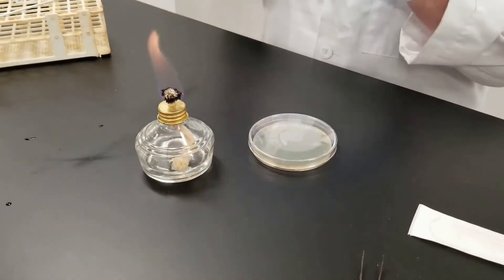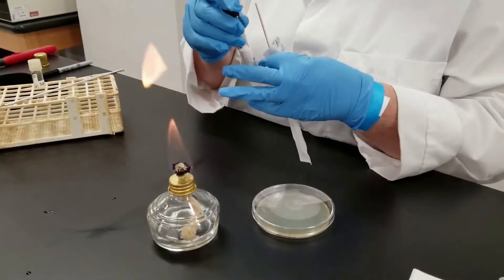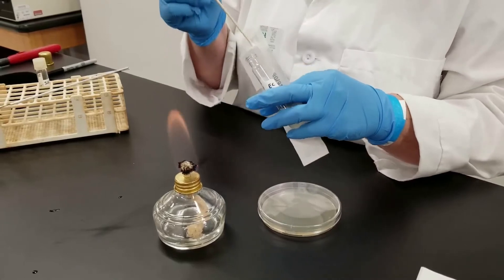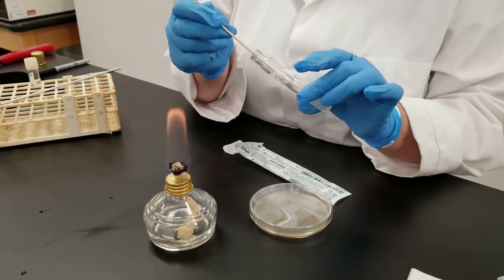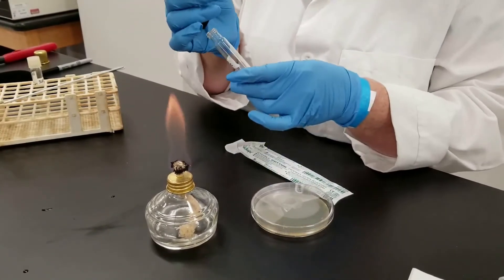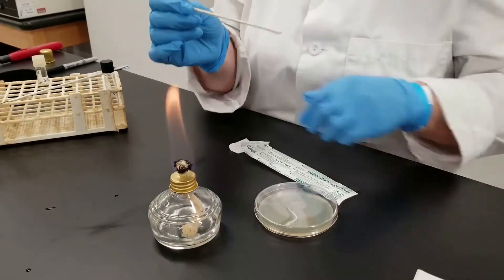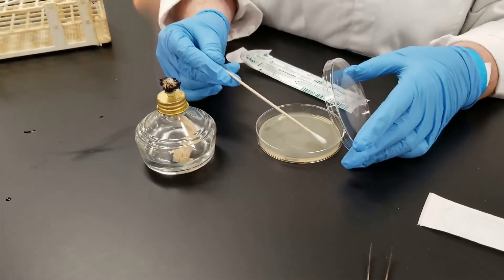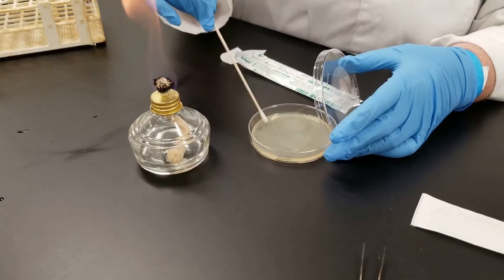We will test the effects of different antibiotics on them. The cultures have been grown in a liquid medium. We're going to flame the loop. We have a cotton-tipped applicator — it basically looks like a fancy Q-tip. I'm just going to dip it into the tube very gently, squeeze off the excess, flame our tube, and put the tube aside. On the plate, I want to get nice solid growth across the entire plate, so we're going to spread the tip of the cotton-tipped applicator.